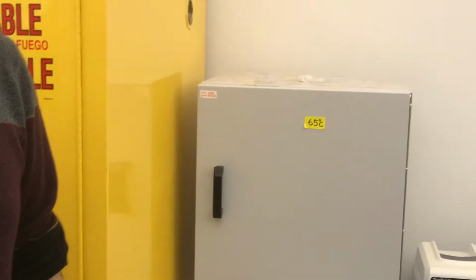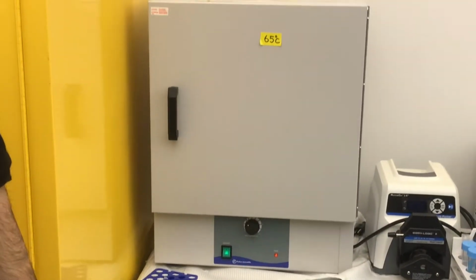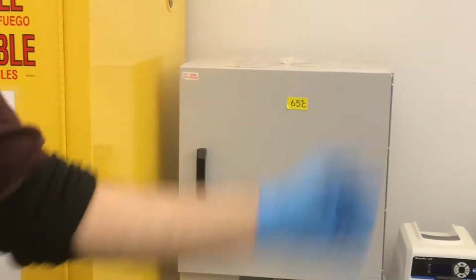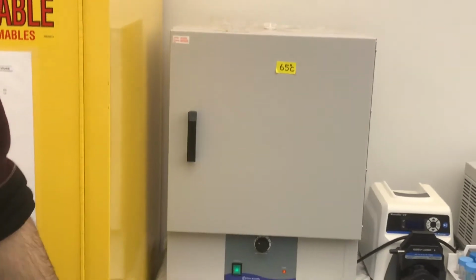So now in here, how long are we going to keep it? For the PA chip, we keep it for 2 hours, but for other chips it's different. For example, for the CEC chip, we keep it for 4 to 6 hours.